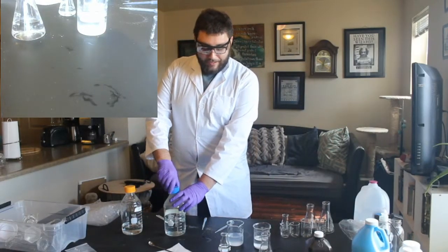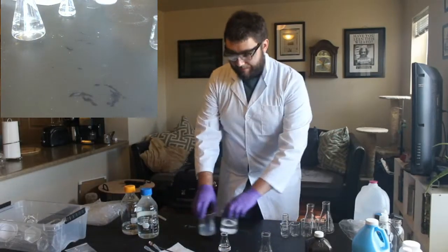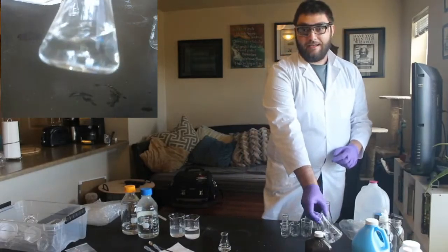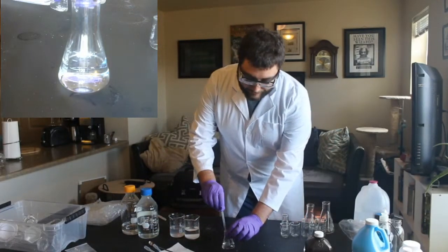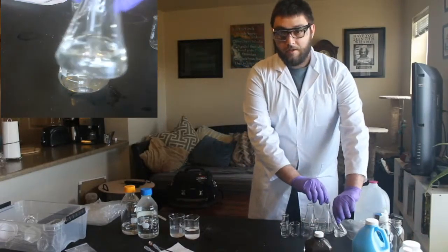So now what we get to do is my real favorite. I'm going to set these off to the side a little bit, is this one. So again, this is still that lead nitrate. We're a clear solution. And I'll start off with the dropper for this. And now we're mixing it with potassium iodide, which again is also clear.